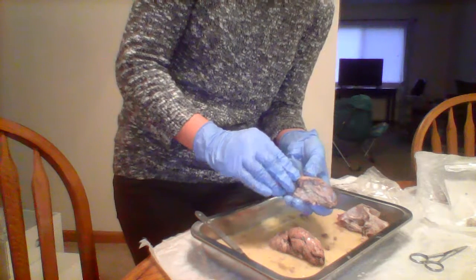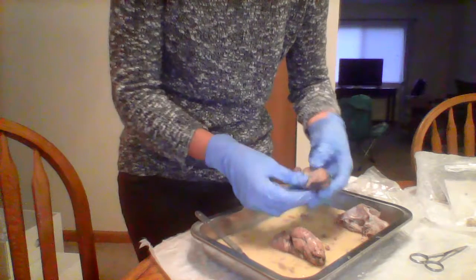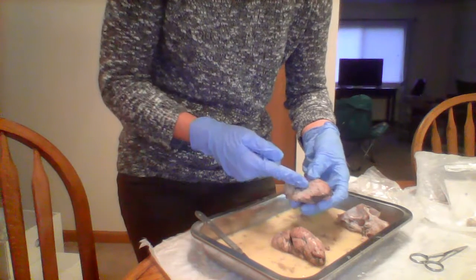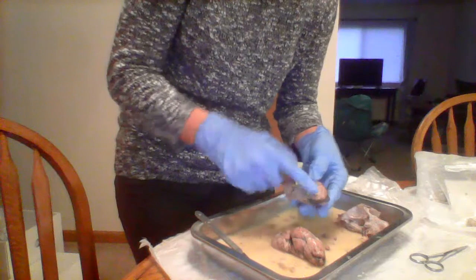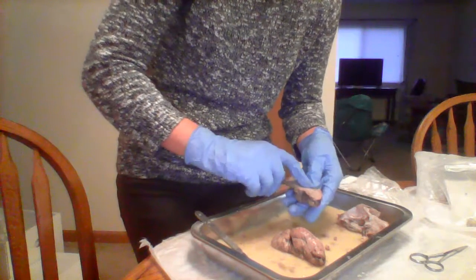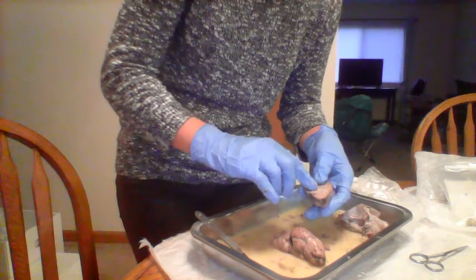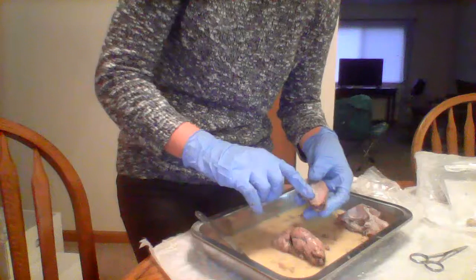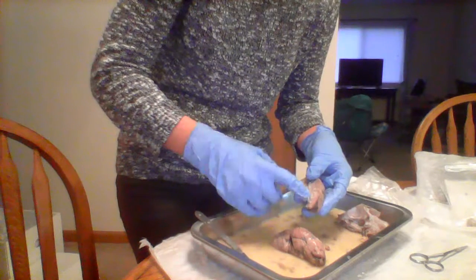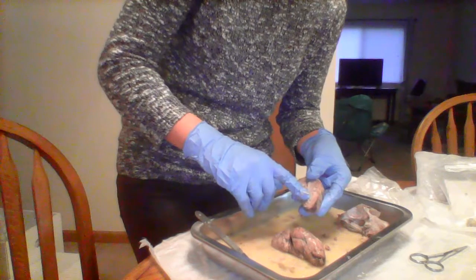The corpus callosum is what I explain it as the inside. There's like a little line hole type thing. It's that thing. The lateral ventricle is in front of the corpus callosum, so it's like another line, almost like the fissure. It's a fissure.